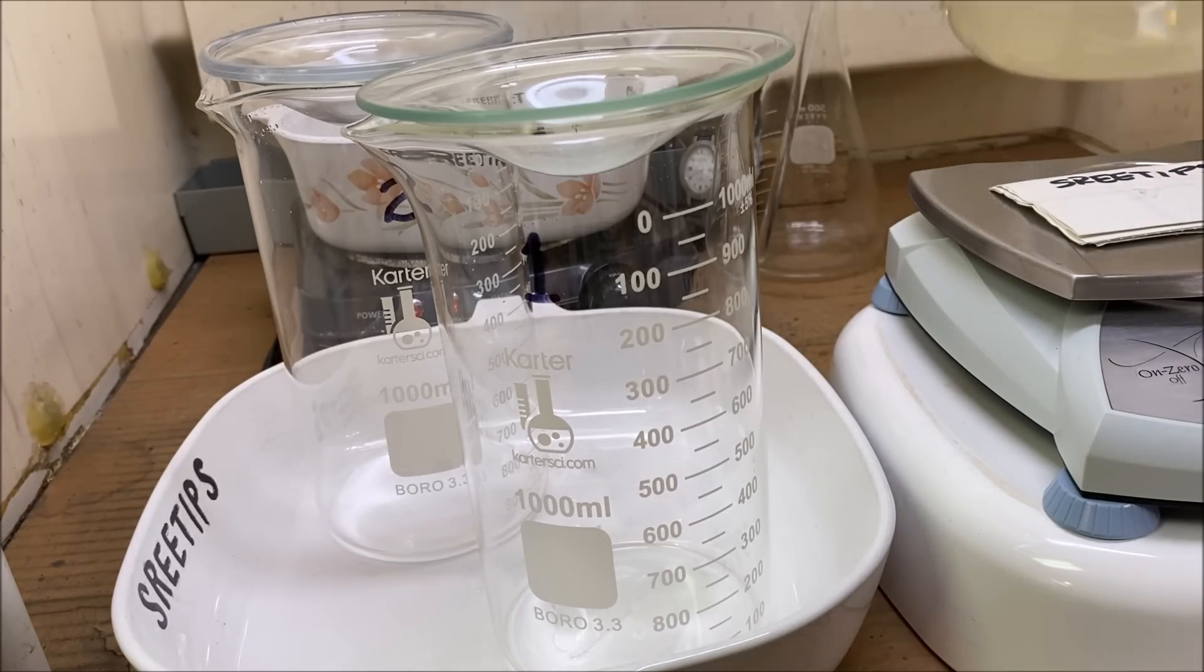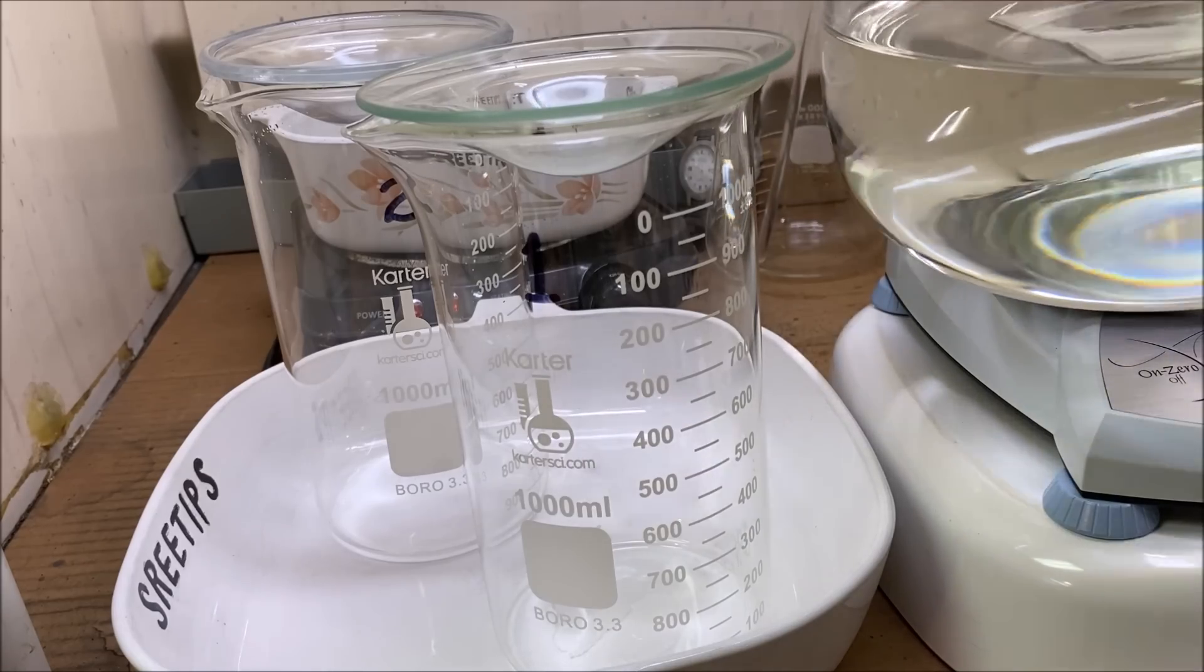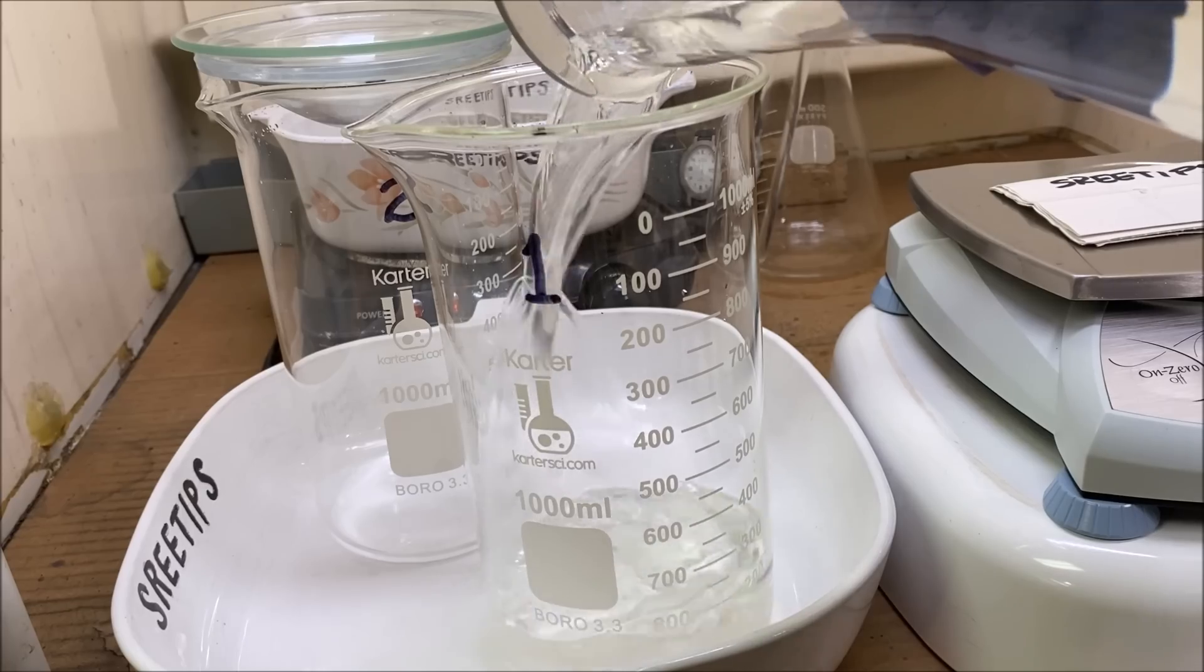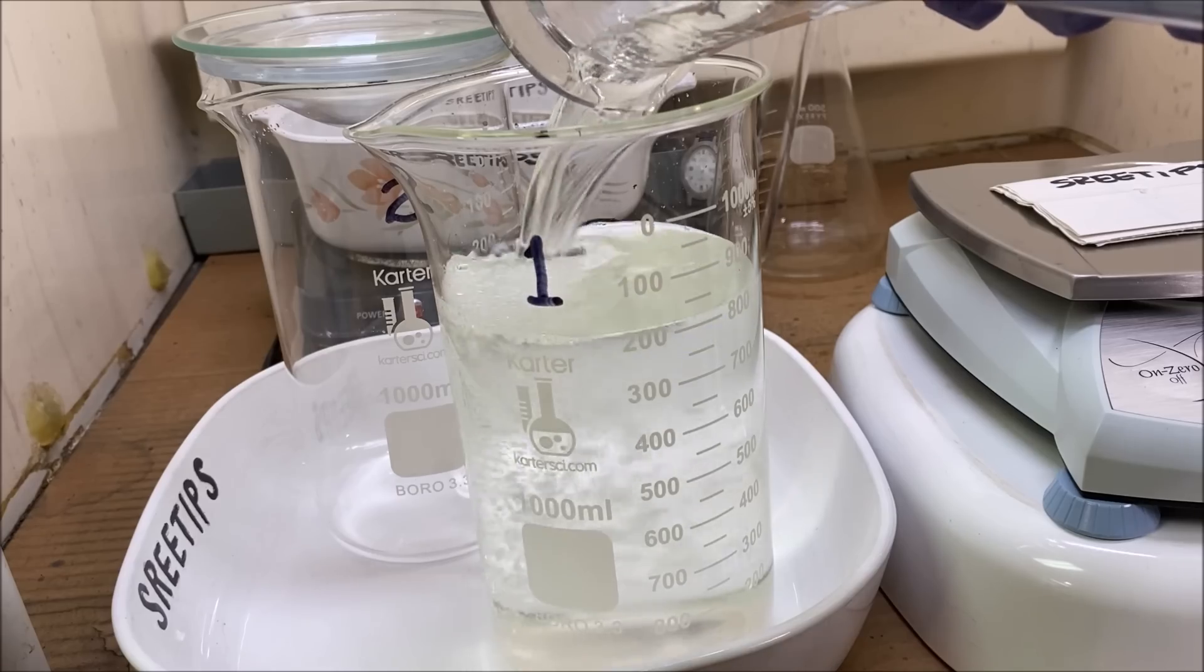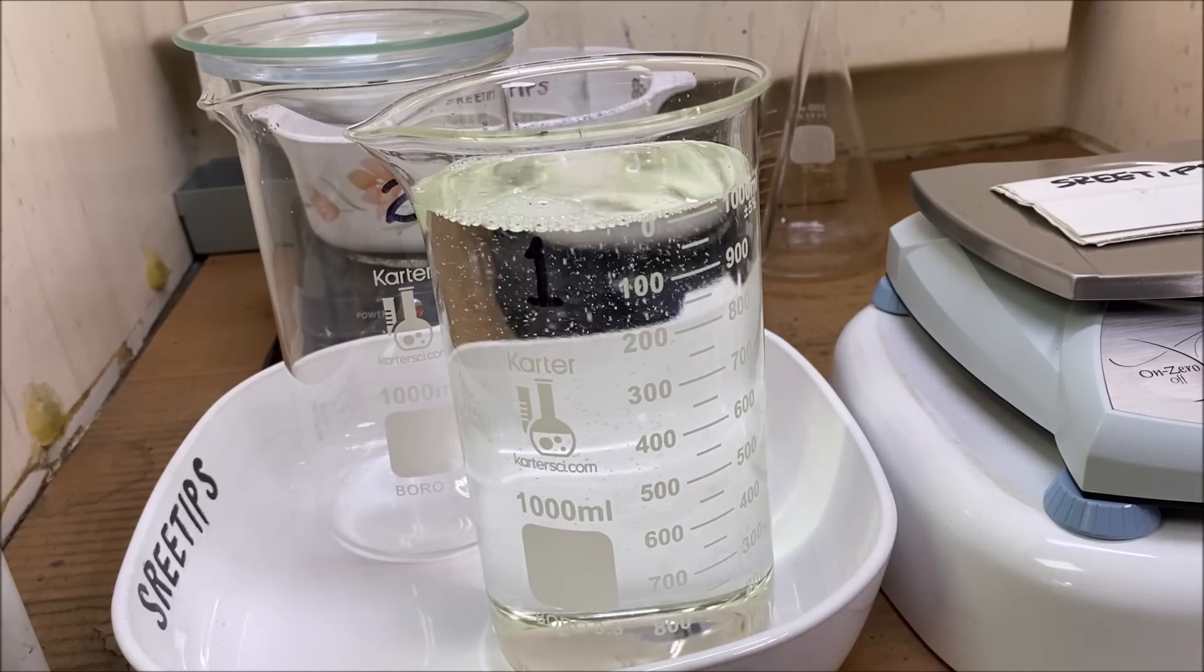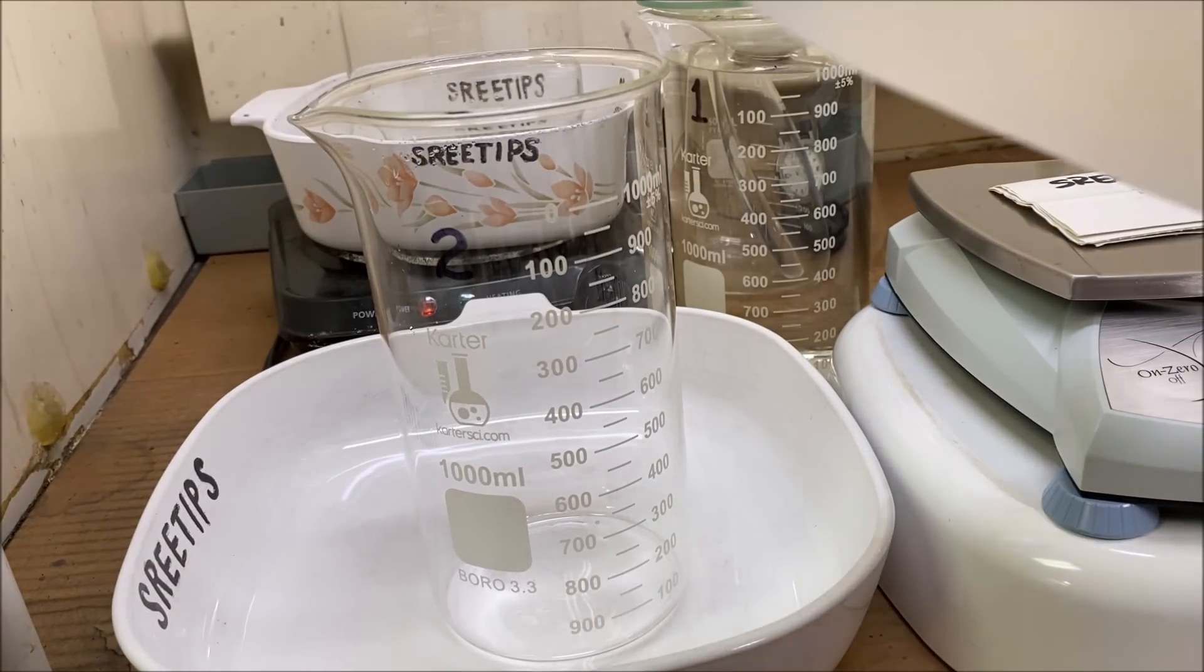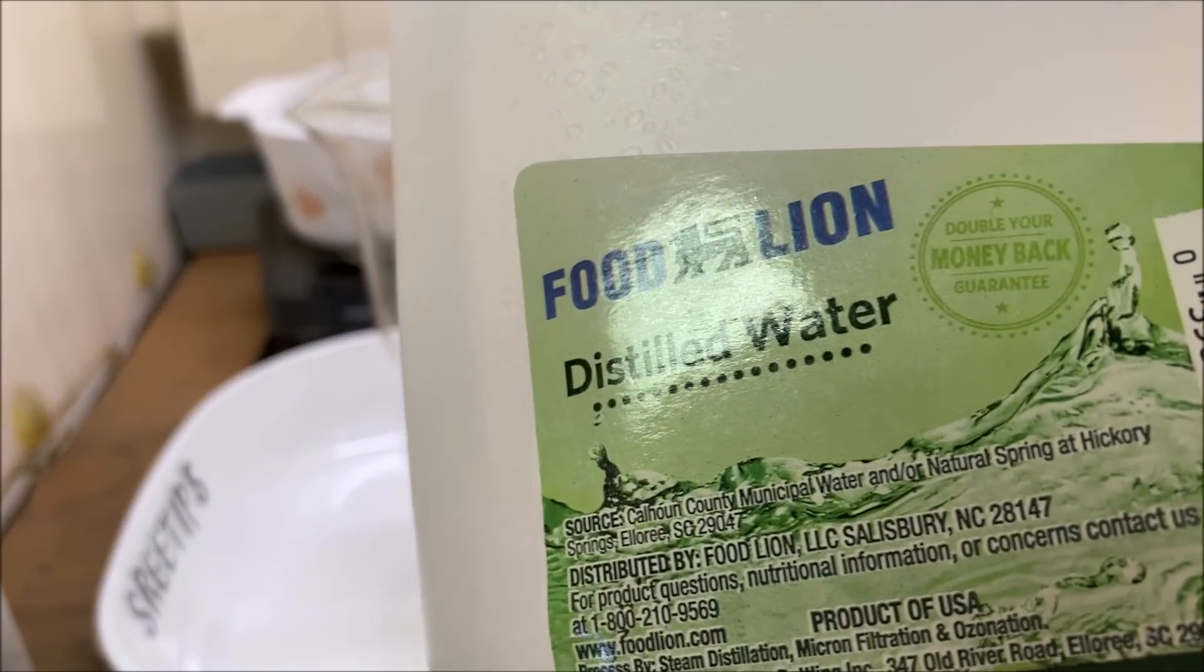Someone had asked about whether or not the electrolyte is heavy or what the density of it was, so what I'm going to do is measure out one liter of this electrolyte in a beaker. Now we're going to measure out one liter of distilled water in another beaker.